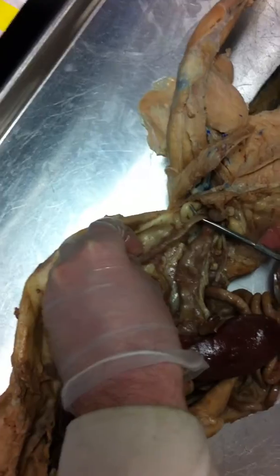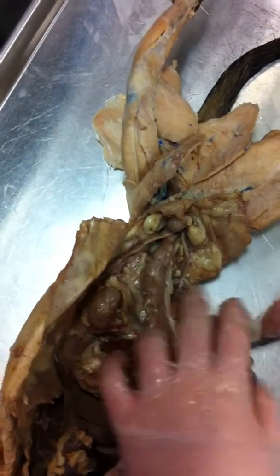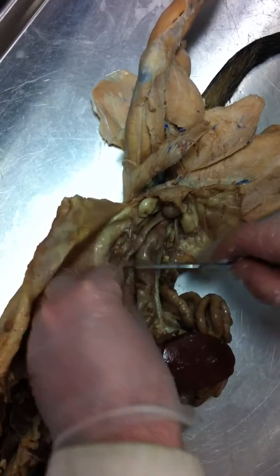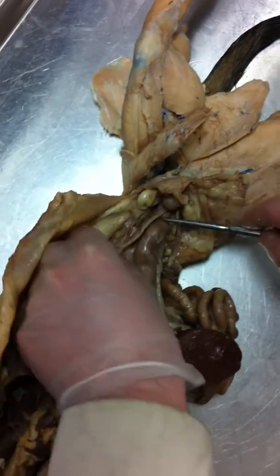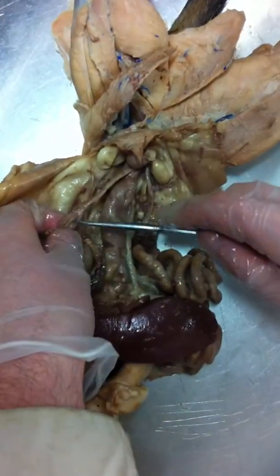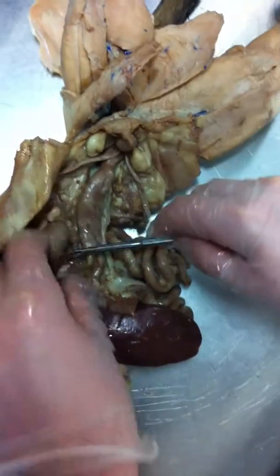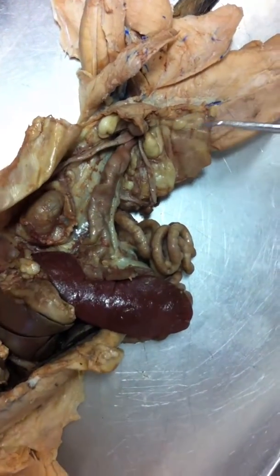going from, let's see. Is that the ureter or is that the ovary? I'm trying to see where it's coming out of. I would not know. It's probably the ovary here. It's a female cat, right? Yeah. Do we need to know the ovary? No, you don't have to know. Yeah, the ovary's here. This is the ovary. This would be the horns of the uterus. The ureter usually comes out of here.